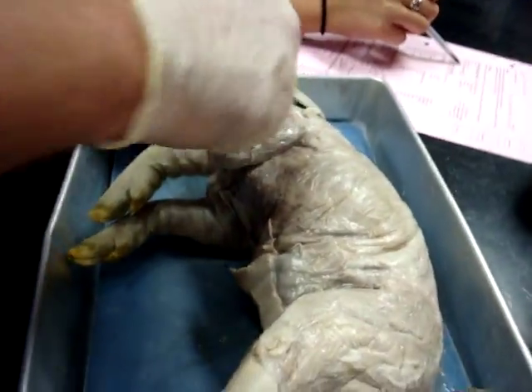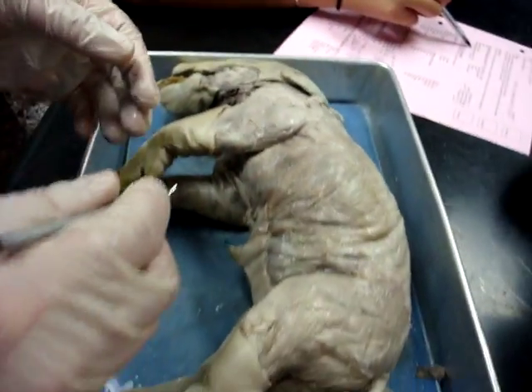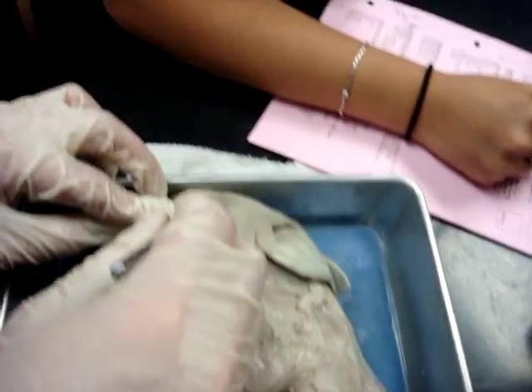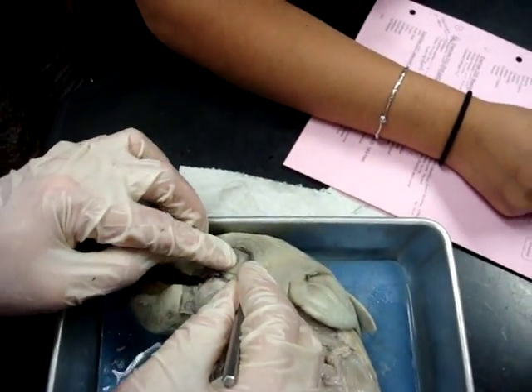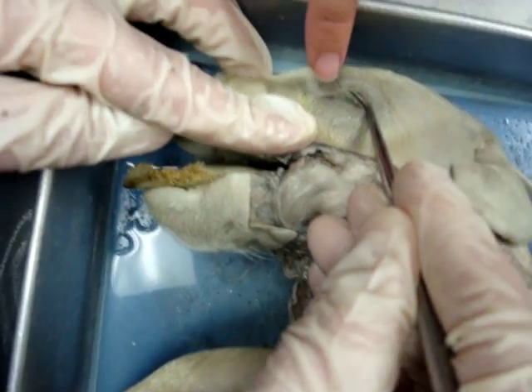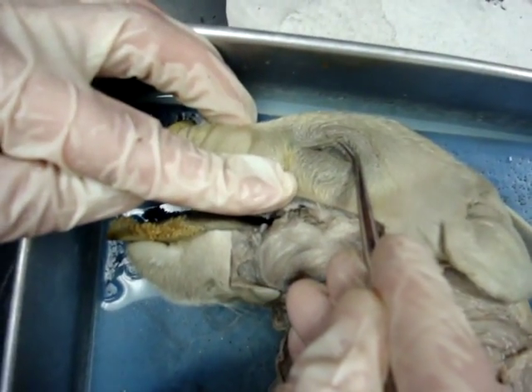I think that's everything posterior. Show me your pinna. The pinna — is it ear flaps? Yep, there you go. And your eyes. And your nictitating membrane — is the white... can you get in there? See the corner? You've got a good nice one right there.